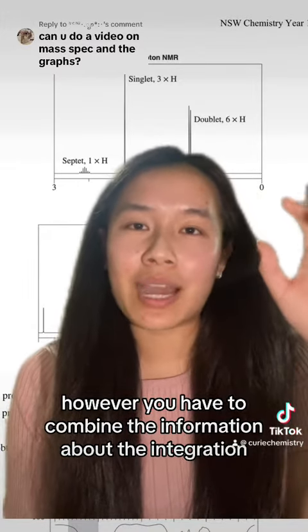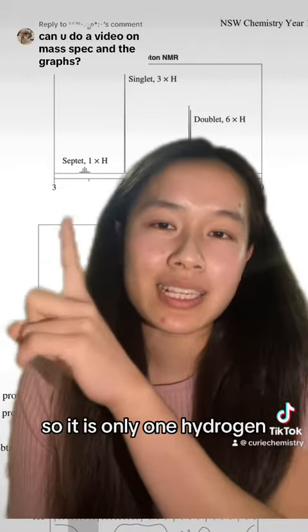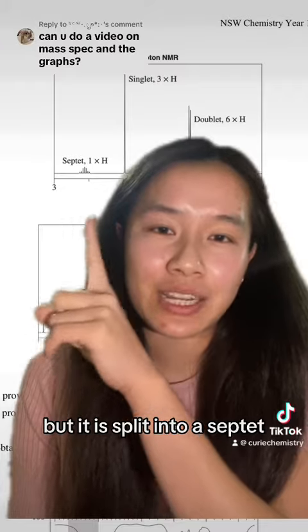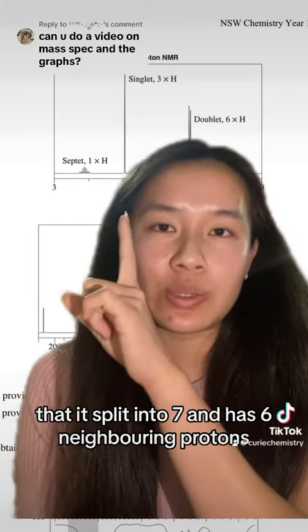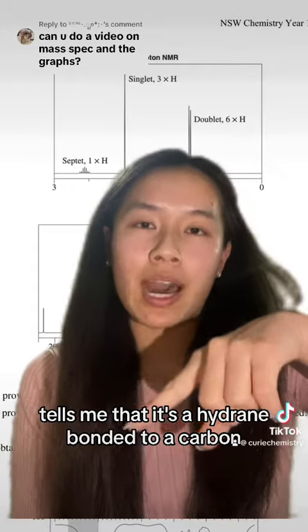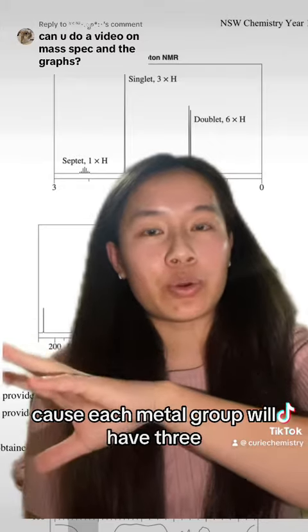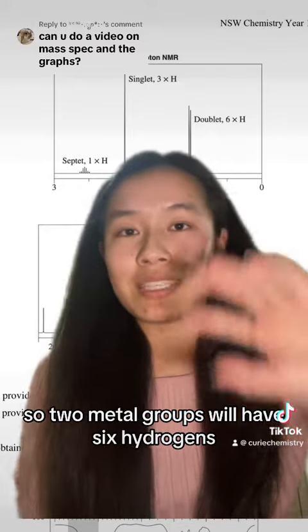However, you have to combine the information about the integration as well as the splitting. So it is only 1 hydrogen, but it is split into a septet. The fact that it's split into 7 and has 6 neighboring protons tells me that it's a hydrogen bonded to a carbon, and that carbon is bonded to 2 methyl groups because each methyl group will have 3, so 2 methyl groups will have 6 hydrogens.